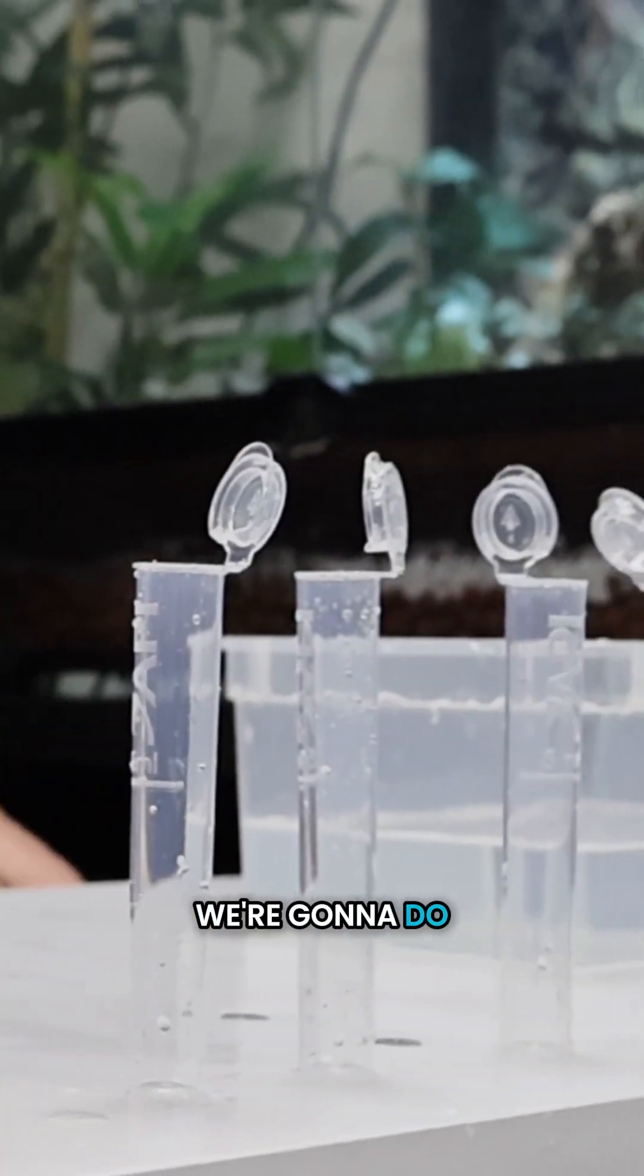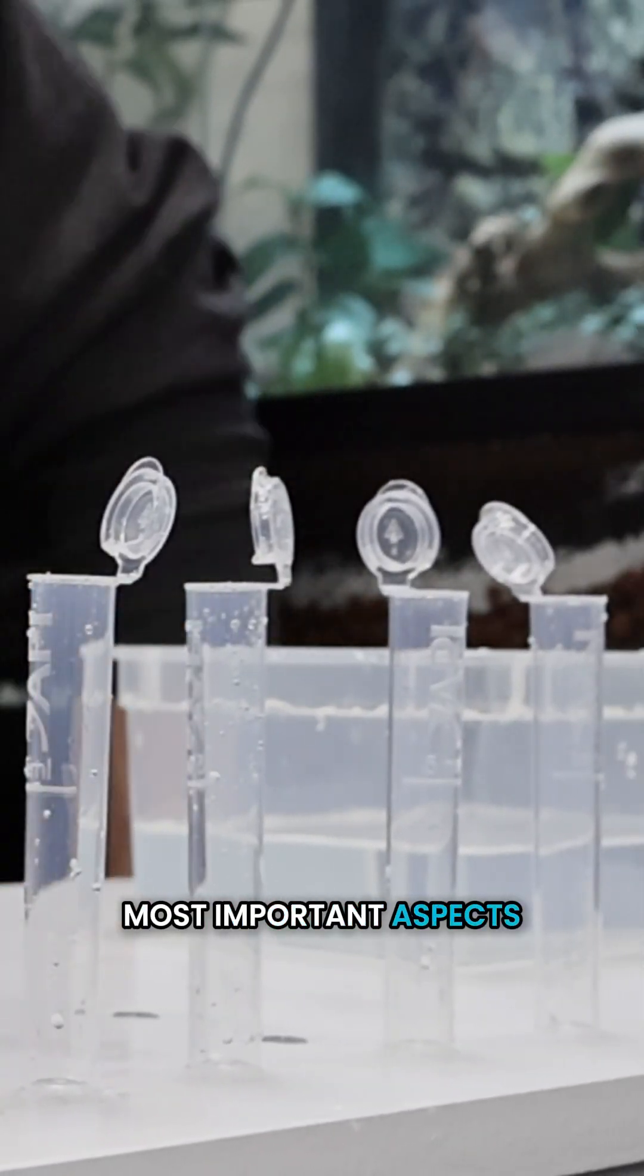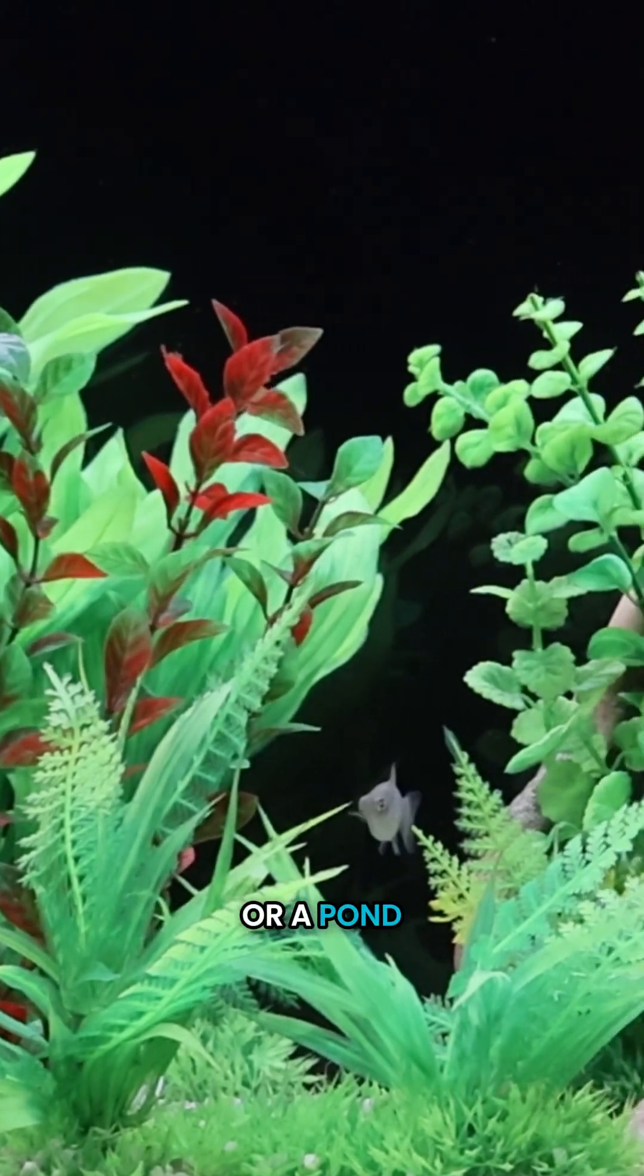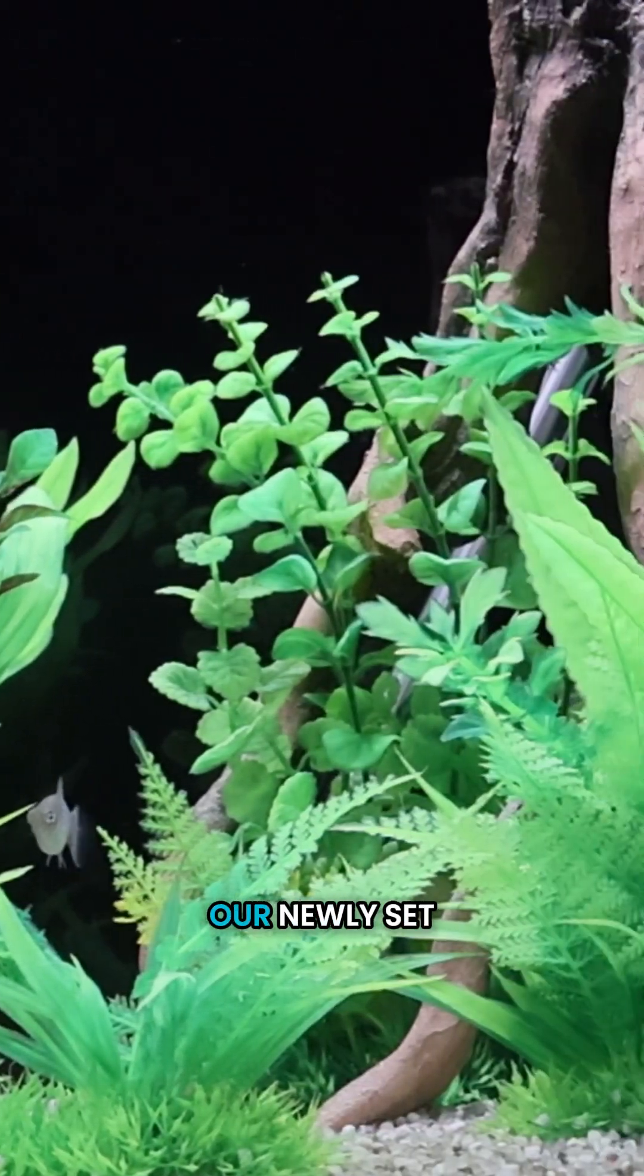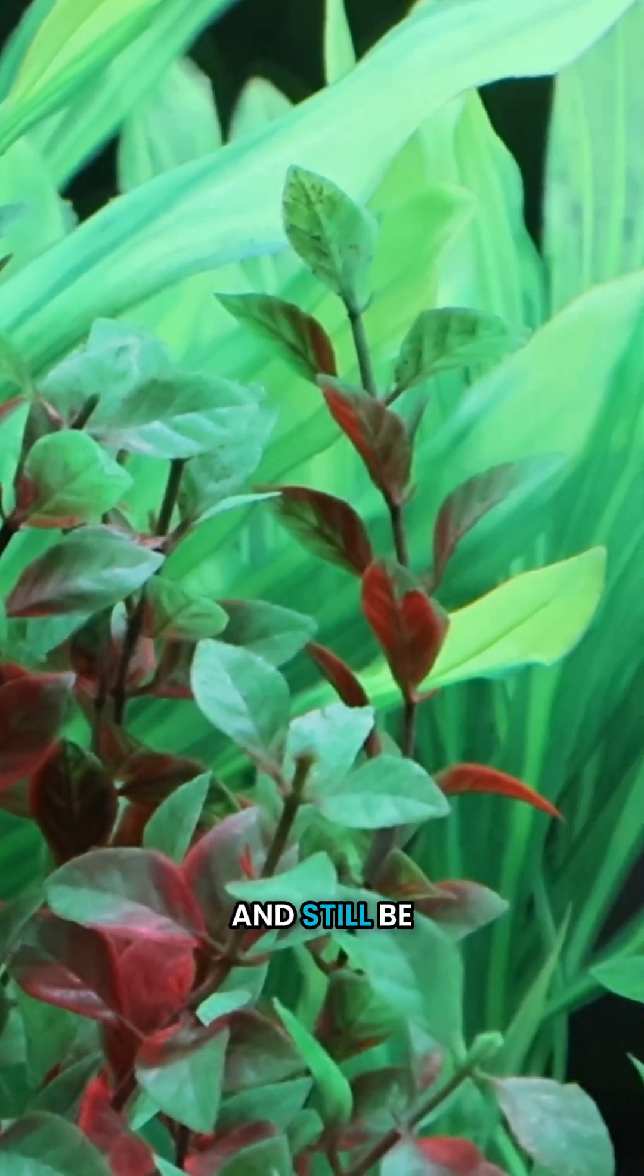Hi guys, it's Jeremy here and today we're going to do one of the most important aspects of fish keeping—be it an aquarium or a pond—and that's test the water. So we've got our newly set up aquarium here. It's got chlorinated tap water in it, but water could be crystal clear and still be deadly.